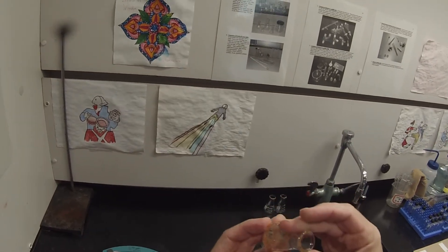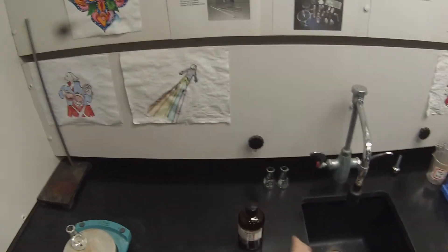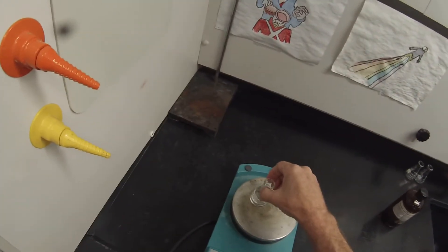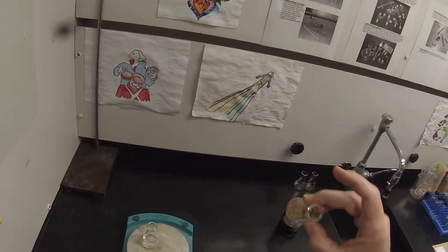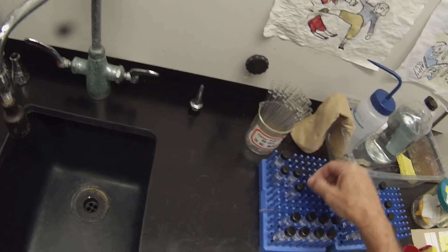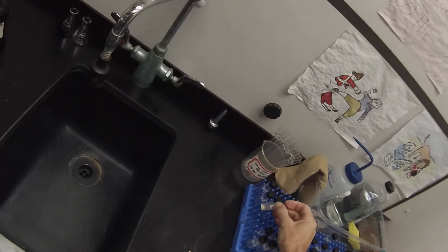I'm not sure if we'll need a bigger flask to get it to dissolve in pure hexane, because last time it didn't seem to be particularly soluble in it. Maybe it's just a matter of leaving it a little bit longer to get it to behave itself. We'll get that hexane boiling and then gradually add it and hopefully get all this to dissolve. If that works, we have the other sample of tryptamine from the first isolation — a considerably nicer white powder. See if we can get a better yield.